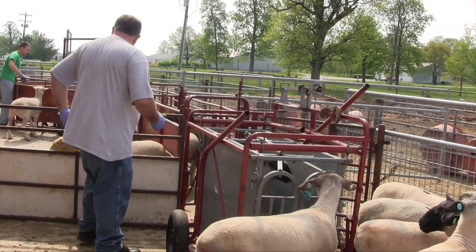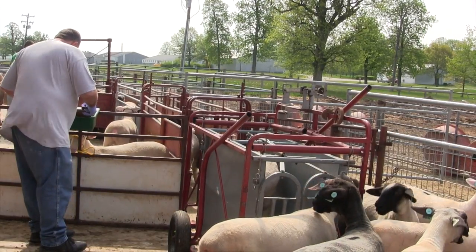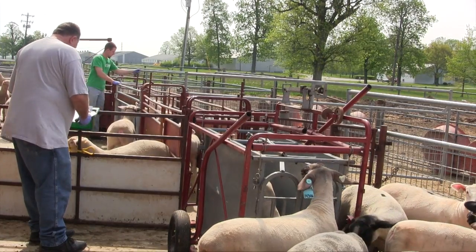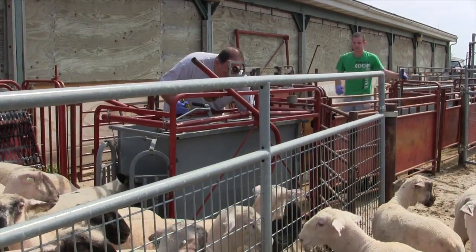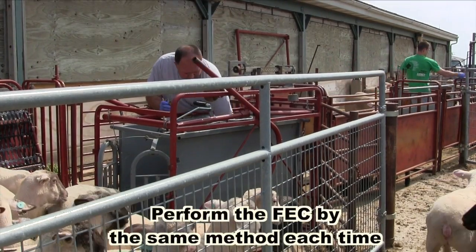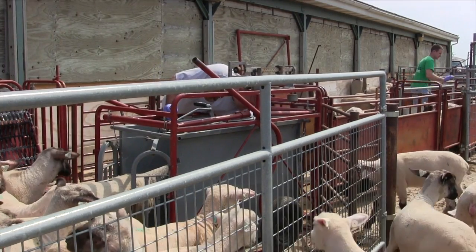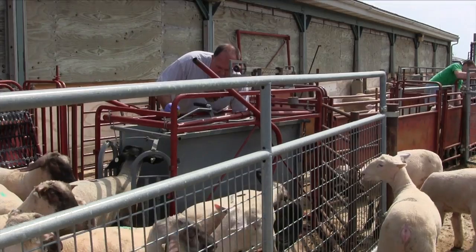Now that we've got a clear understanding of how specific gravity allows us to quantify the number of eggs and the supplies to perform it, let's go through it step by step. There are a variety of ways to correctly conduct an FEC. Just remember, it is most important to conduct it the same way every time. This is the procedure adopted by our lab with some possible modifications explained.